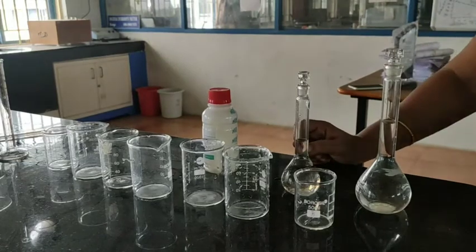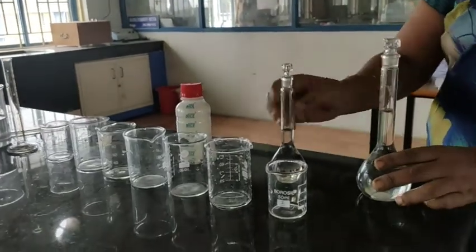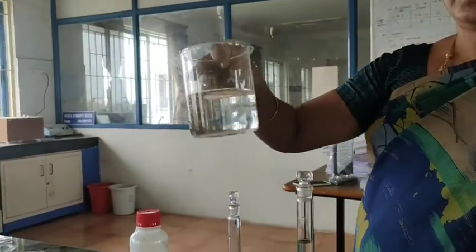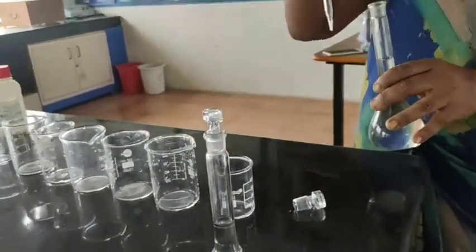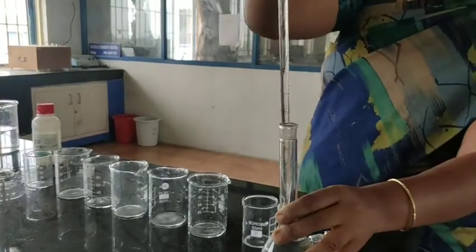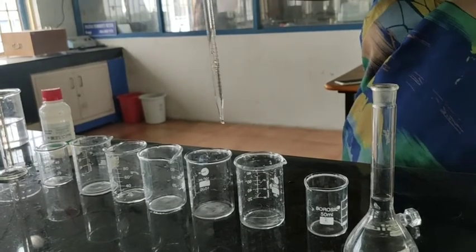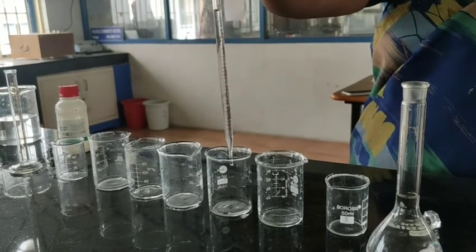Our sample is ready. Now we have to prepare the standard solution of saccharin as well. The stock solution is of 200 ppm. From that we will take different volumes of the stock solution and dilute it to obtain linear concentrations — taking 0.5, 1, 1.5, 2, and 2.5 ml portions from the stock solution.